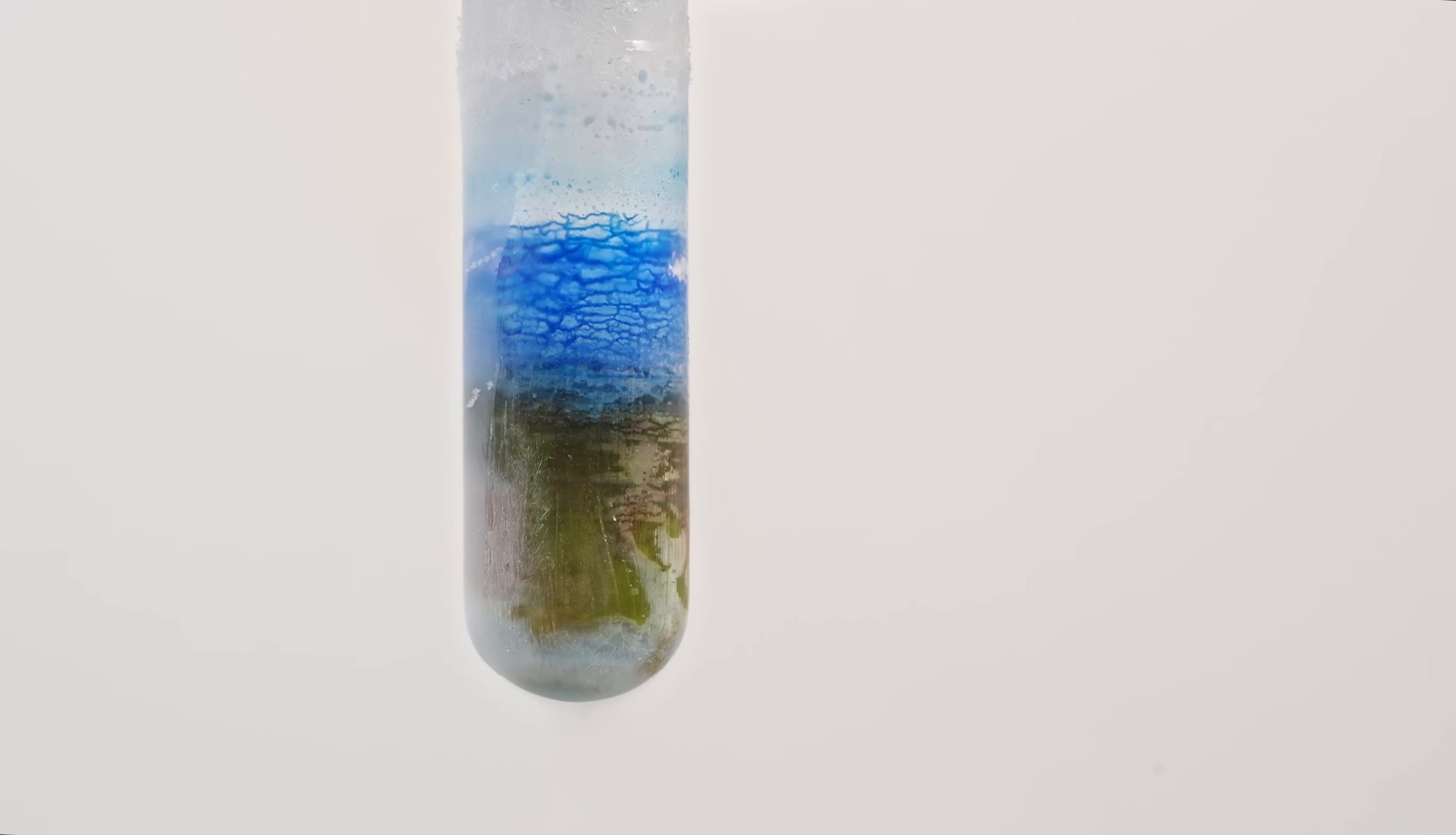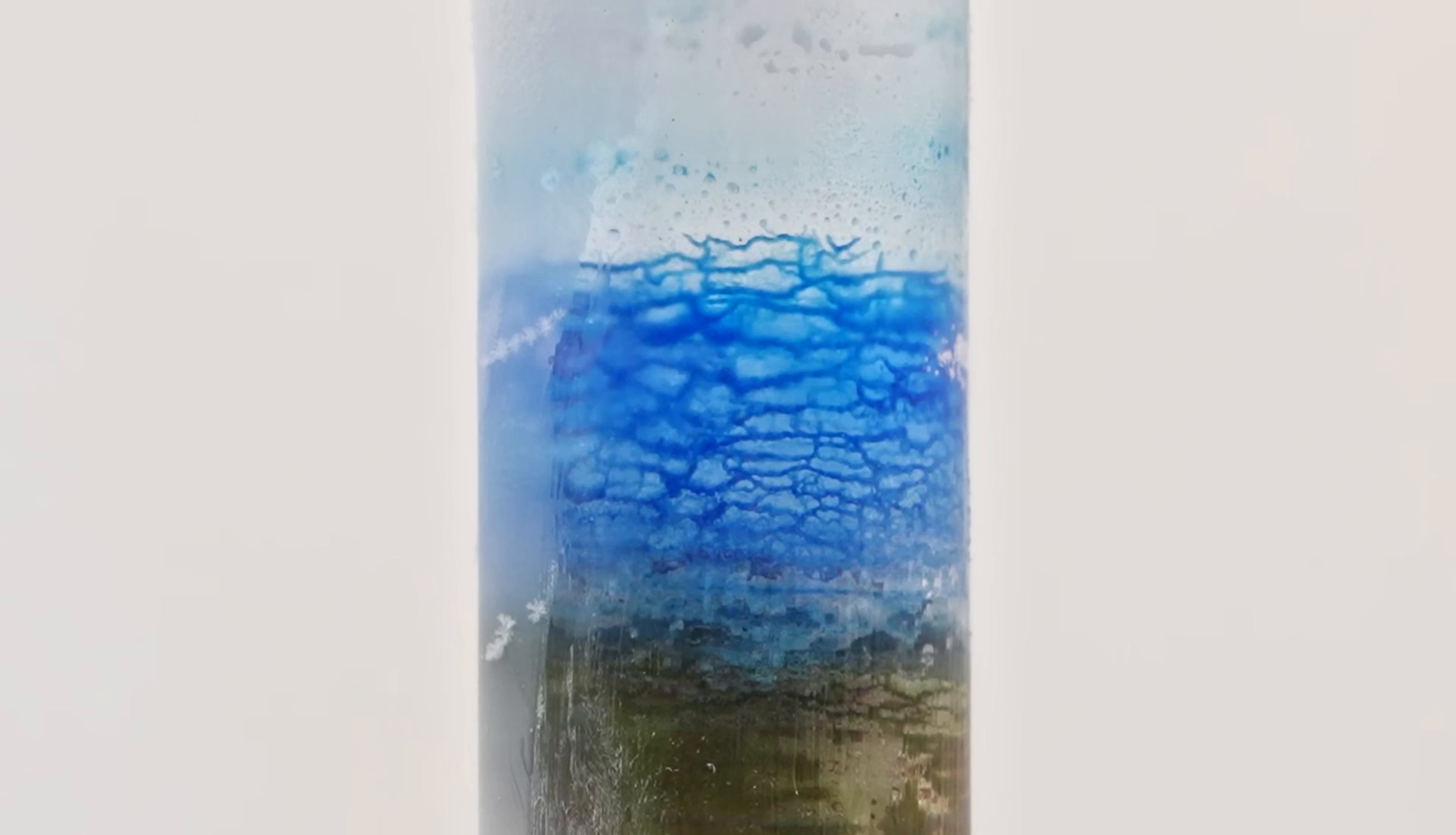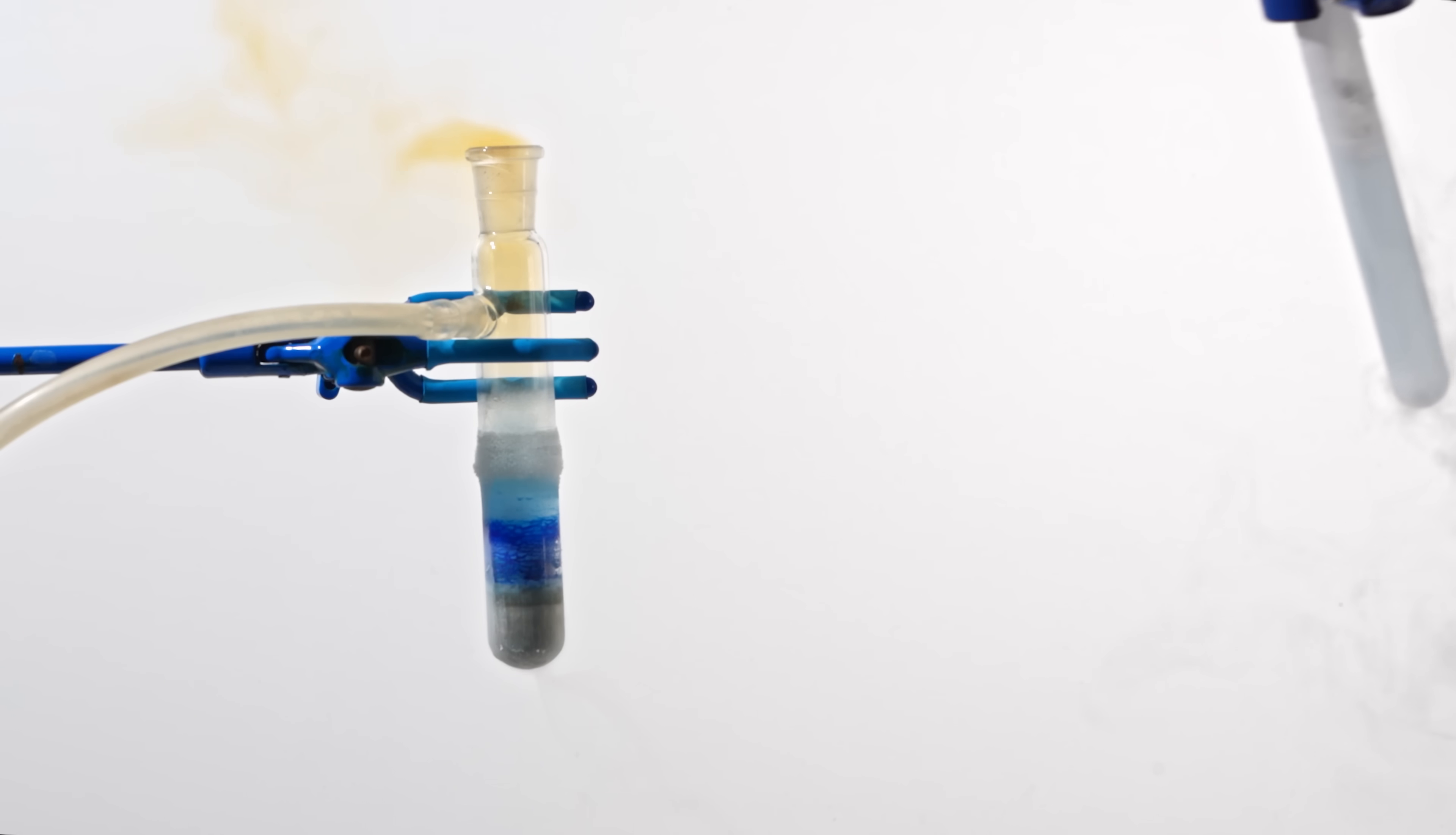Let's determine which substance corresponds to each color. But first, let's see what happens when we add liquid oxygen. Will we observe red-brown smoke? How do you think?